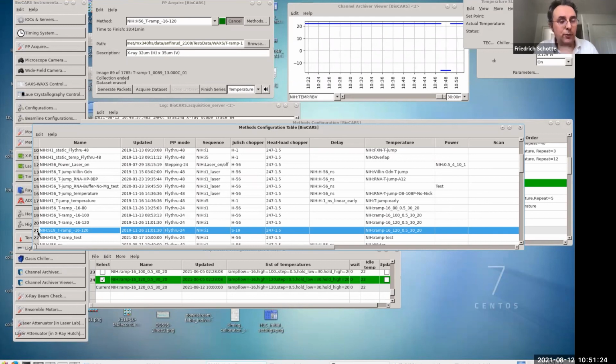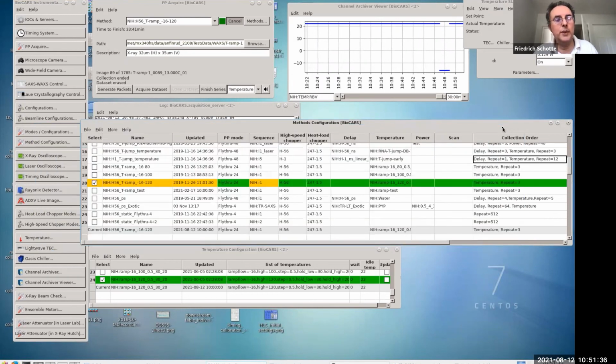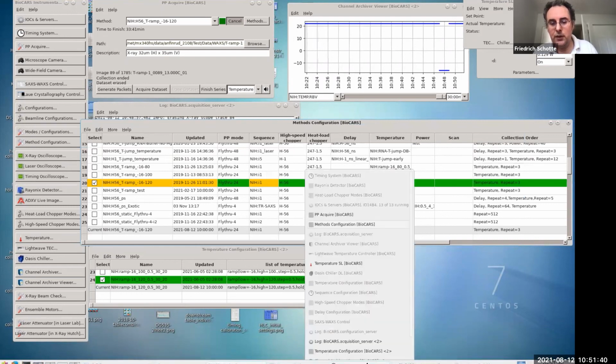I just tried to demonstrate this. I think this is what Philip wanted me to show. But I'm not going to execute this right now. I just wanted to make sure everything works by restarting these IOCs.